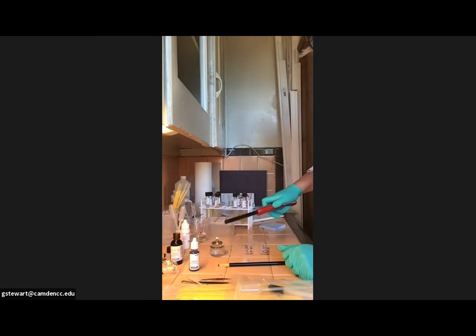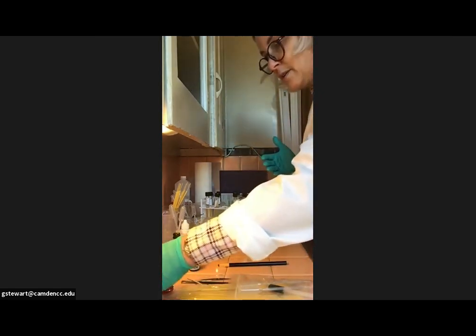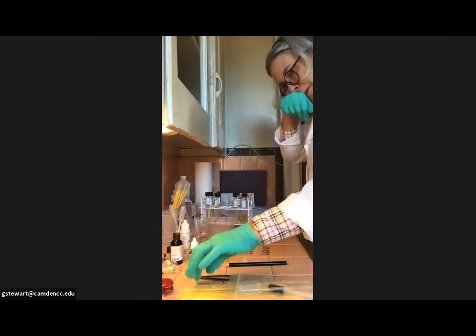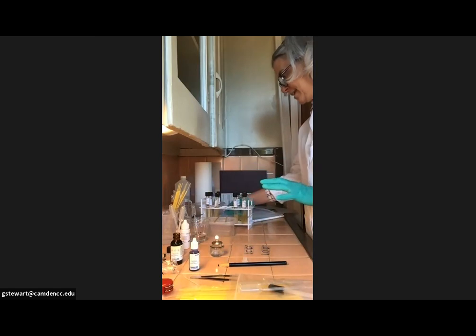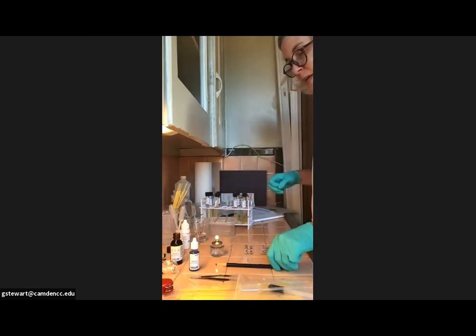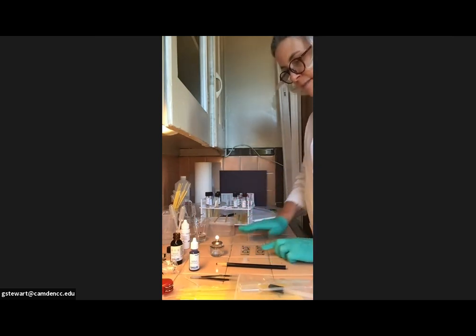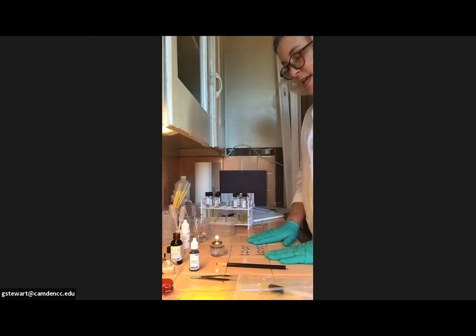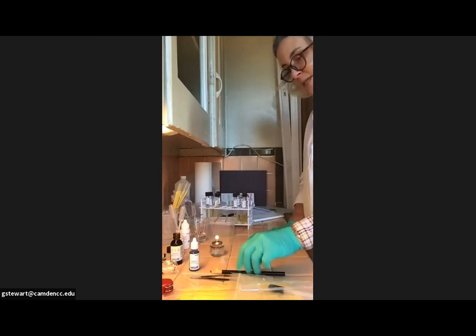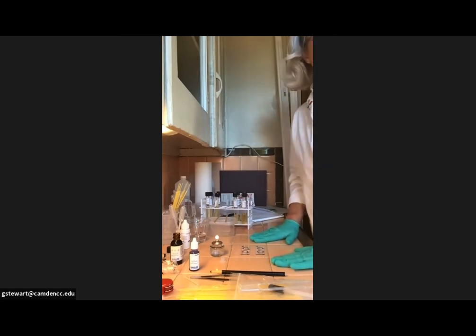Speaking of which, please put your lab apron on, wearing closed-toed shoes in case you drop something. And it would be probably best if you used your safety goggles. I'm wearing my glasses, so my reading glasses, so I'm taking that to be good enough, but it's up to you. So the first thing you want to do is when you have your two slides, I prefer to lay mine right on the lab bench, not on a piece of paper or paper towels, because it does tend to make the work surface a little bit unsteady. It's totally up to you.